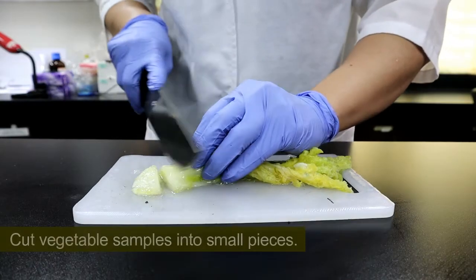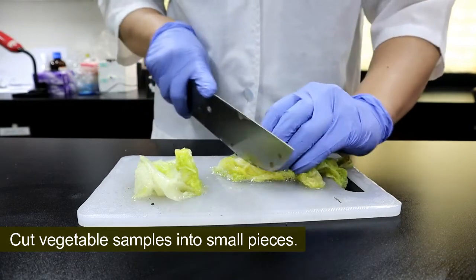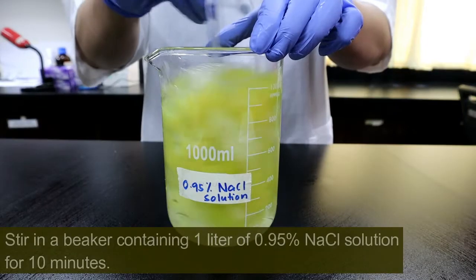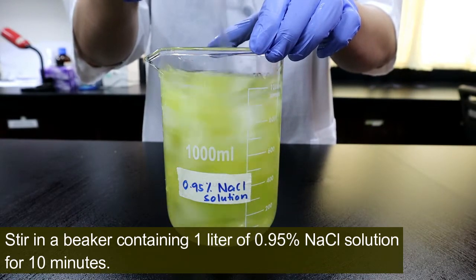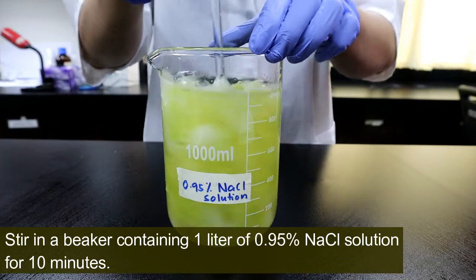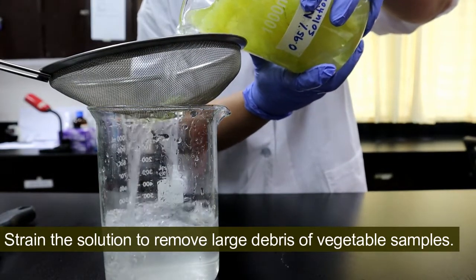Cut vegetable samples into small pieces. Stir in a beaker containing 1 liter of 0.95% NaCl solution for 10 minutes. Then strain the solution to remove large debris of vegetable samples.